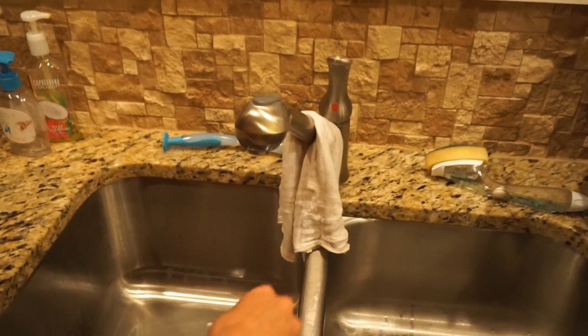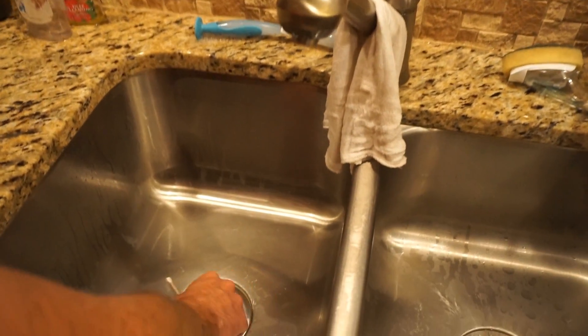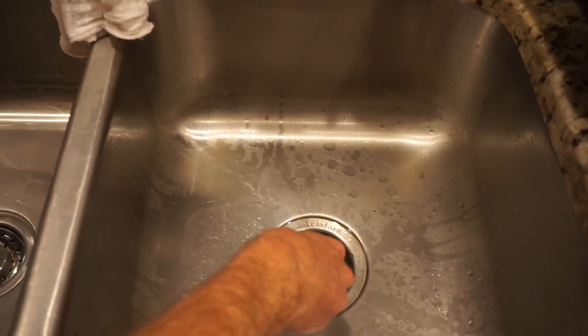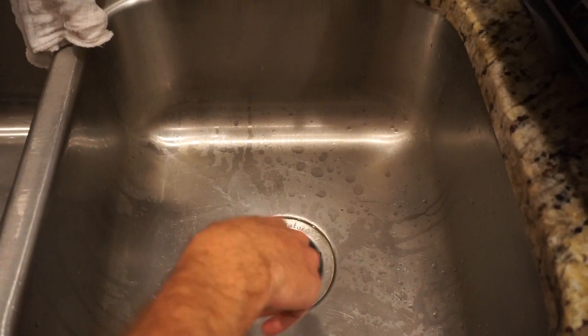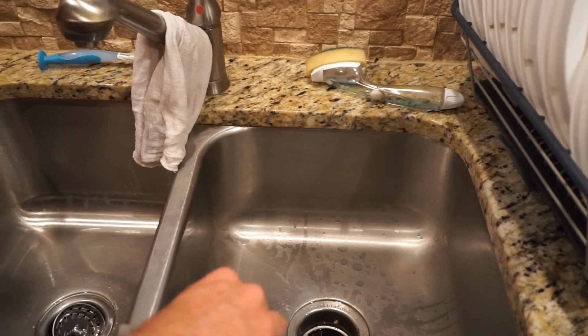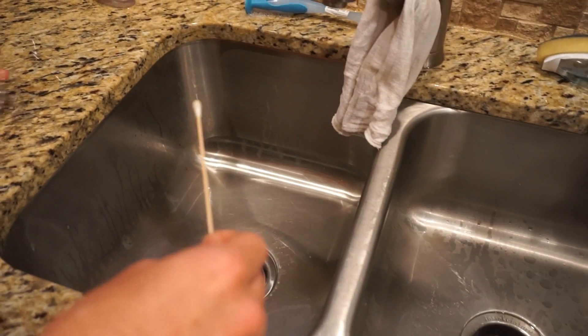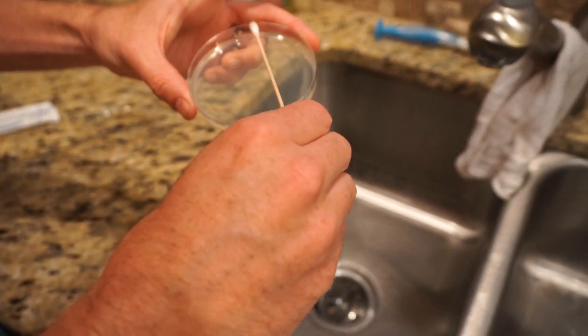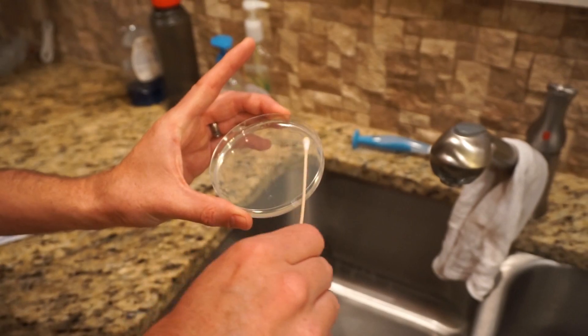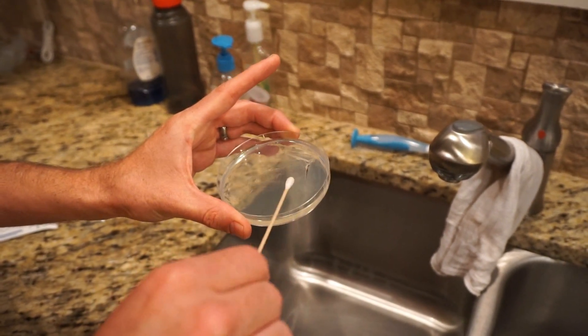Next I'm getting the kitchen sink. This is just going to be representative of the sink area that you're touching — you might reach in here and grab some dishes. This is also freshly cleaned. We'll see how dirty it is though.